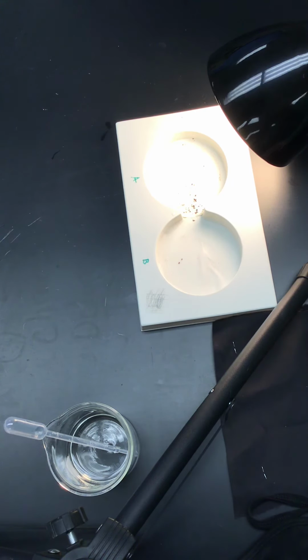Hello, ladies and gentlemen. Today we will complete Part B, the student design portion of the Isopod Behavior Lab. The goal of this lab is for you to design and conduct an investigation of animal behavior. Since you are not here at school, I am conducting the experiment for you, and you will evaluate the results of the experiment on your own.